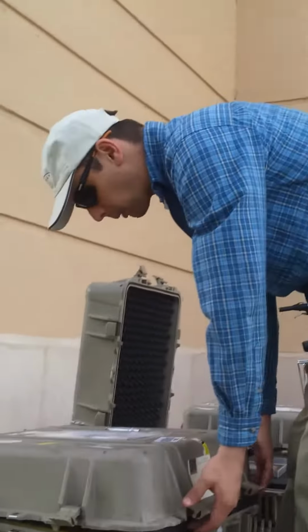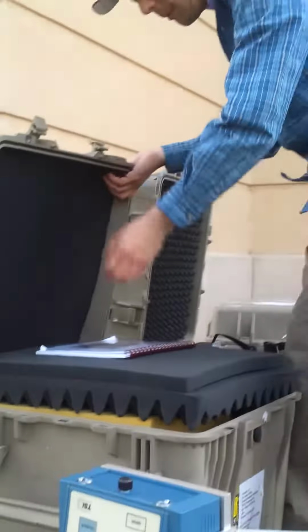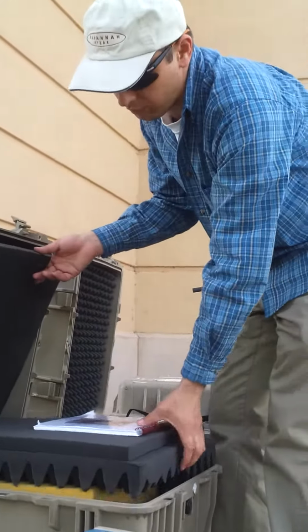Maybe it's not a bad time to mention box 3. Yes. Yeah, I was wondering. So box 3 basically contains other supplies that you need to run the Pi Swirl long term.